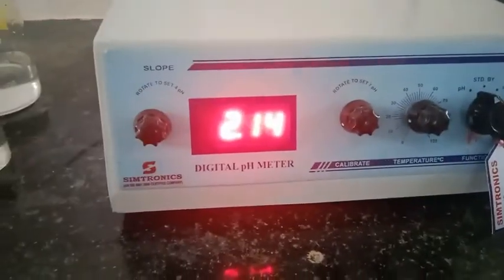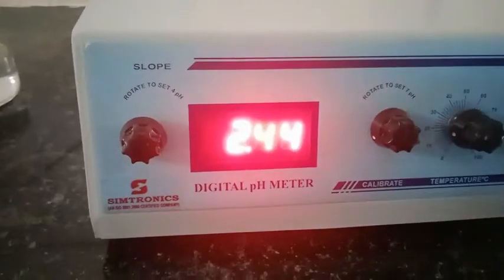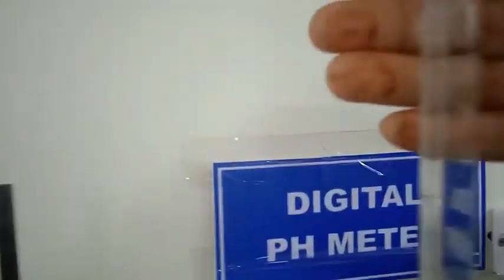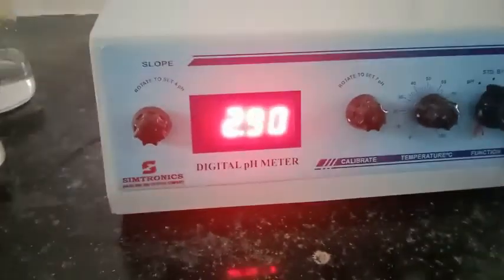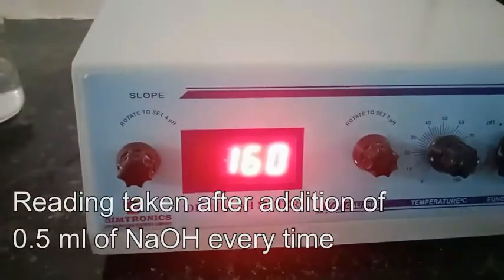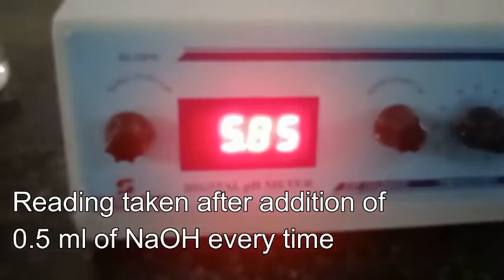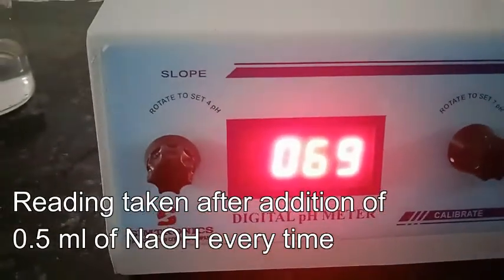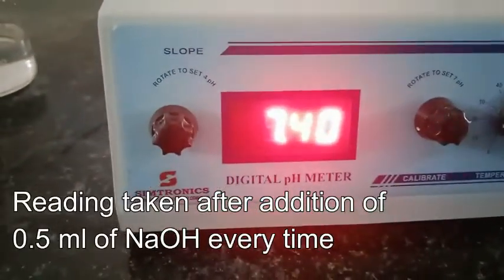Up to 18 ml we are having only small changes — at this point 269 millivolts and pH 2.44. Up to 22 ml of NaOH the reading reaches 2.51 — changing very slowly. Now we switch to adding 0.5 ml of NaOH for each reading, and you can see the sharp change: 4.25, then 5.85 on adding each 0.5 ml of NaOH to the HCl solution.